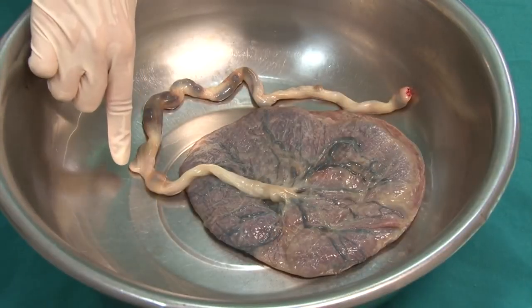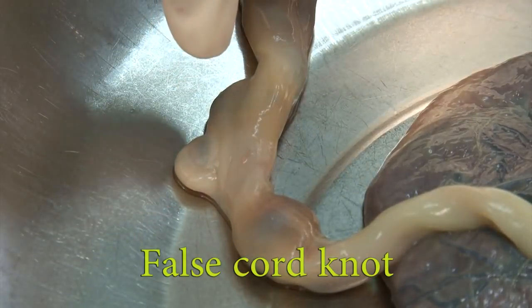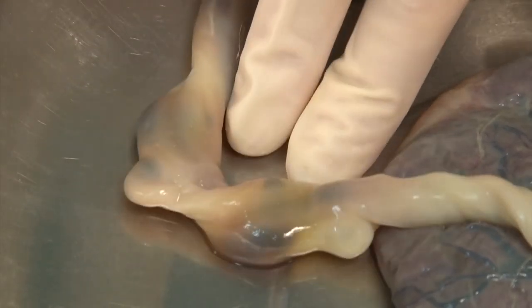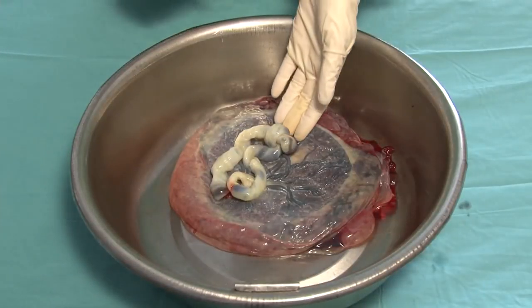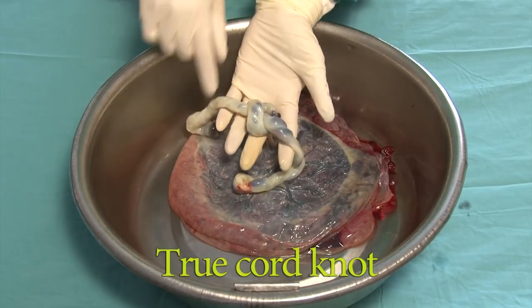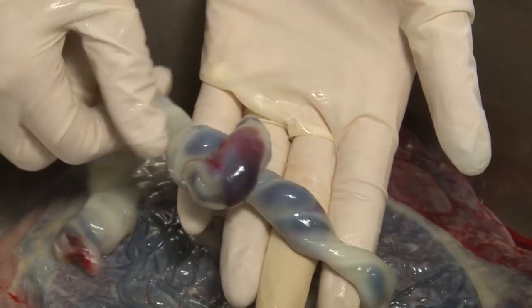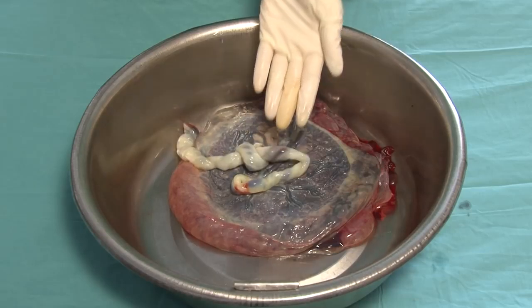Not infrequently, umbilical vessels can form bulges known as false cord knots, which are of no clinical significance. The vessels seem to leave the normal outline of the cord, followed by re-entering the tissue. The occurrence of a true cord knot is more likely if the umbilical cord is longer than 50 centimeters. It should be recorded if the vessels on one side of the knot are more congested than on the other side, which would indicate a notably tight knot.